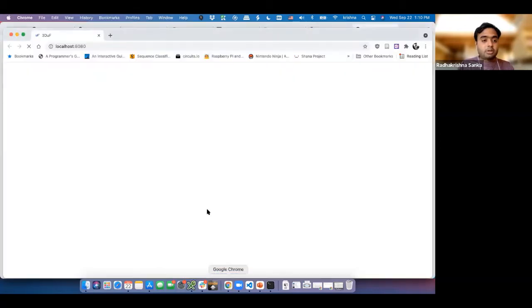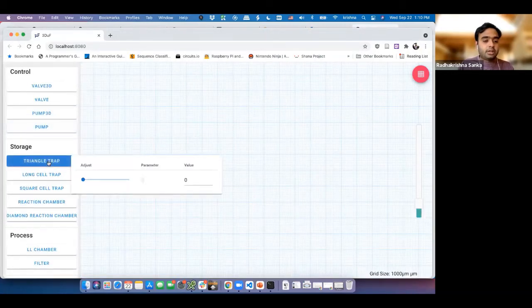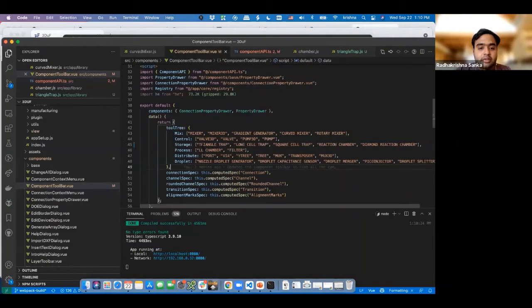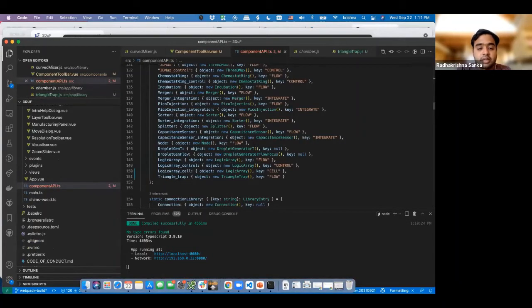So if we go back to our code here, you see triangle trap still here. Then you click on it, and it still doesn't give us anything. Now I'm worried. Why is that the case? It doesn't know it's supposed to put triangle trap, right? The reason it's not doing it is because in our UI code, when we added a new thing, we said you need to look for a thing called triangle trap with this exact kind of text. And even though in component API we said there's a triangle trap drawing definition, it's not going to know from this one.